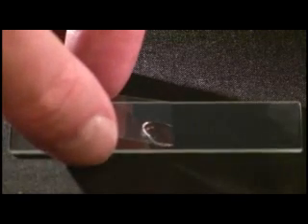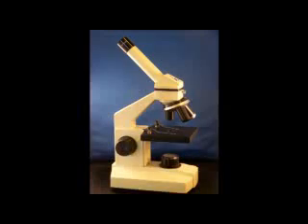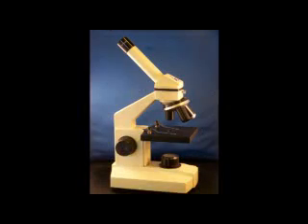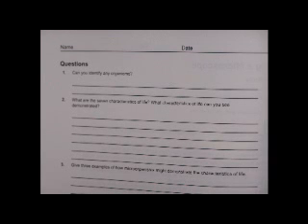Look for any microscopic organisms such as algae or amoebas. Draw any organisms you see under the microscope in your science notebook. Now, answer the questions on your worksheet.